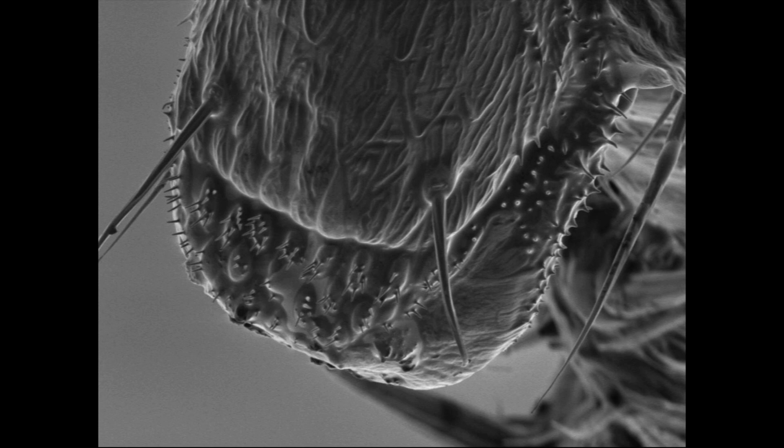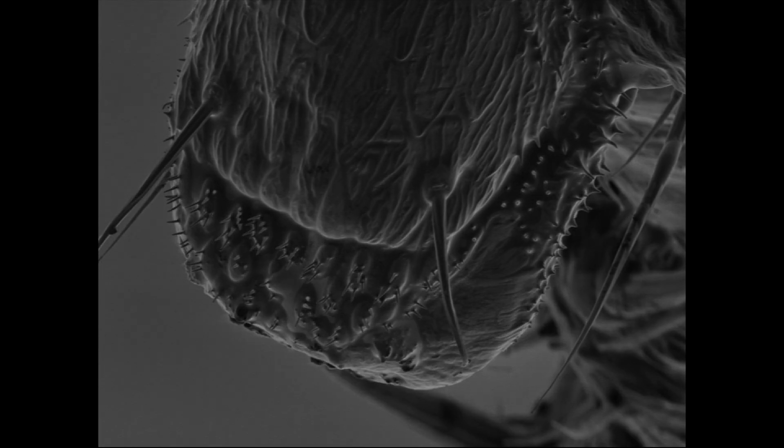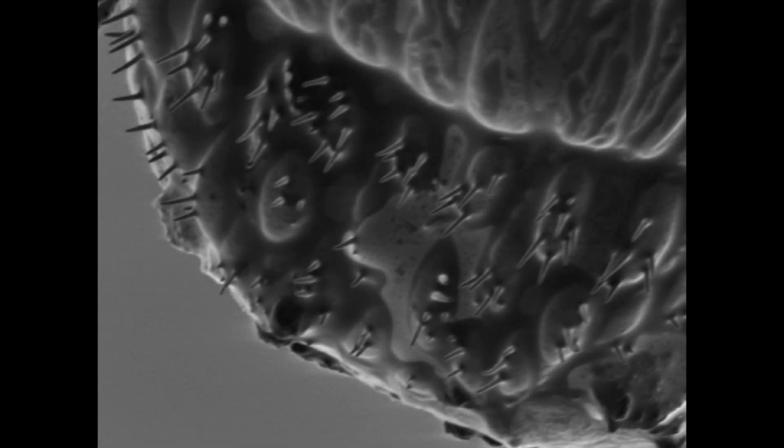The nanosuit method can be used in various situations. Sufficient removal of excess nanosuit solution is the key to successful observation.